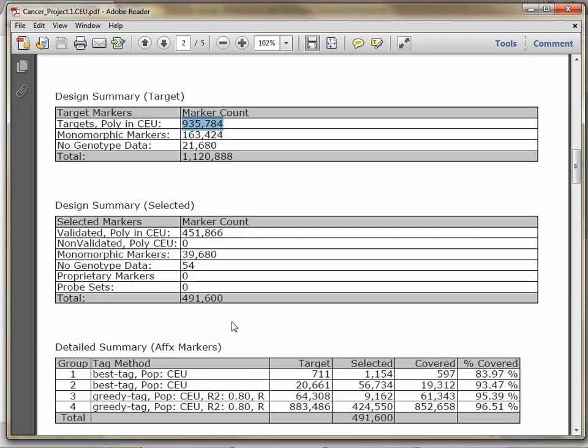So if we look at the detailed summary, I'll show you why this polymorphic and CEU thing is of interest. Marker group 1 was the effort to get all of the non-synonymous SNPs from the target set of cancer genes that we're interested in. You can see that the system has identified 711 target SNPs. Then when we look at the next column, we can see that we selected 1,000 SNPs to cover those 700. That seems weird. Why do we have more selected than we do target?